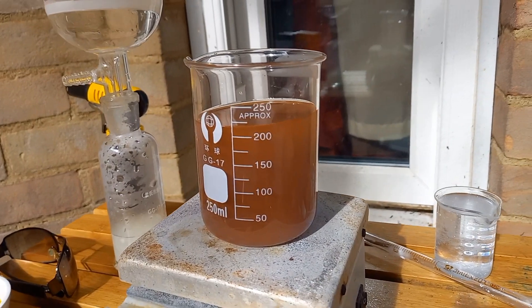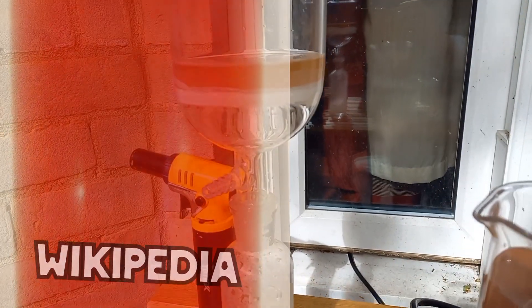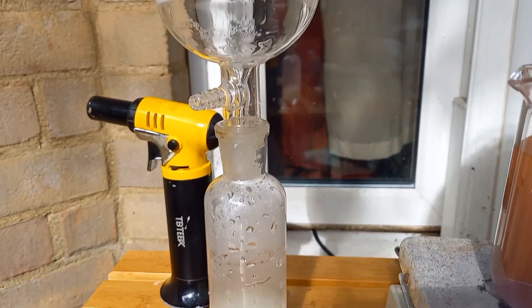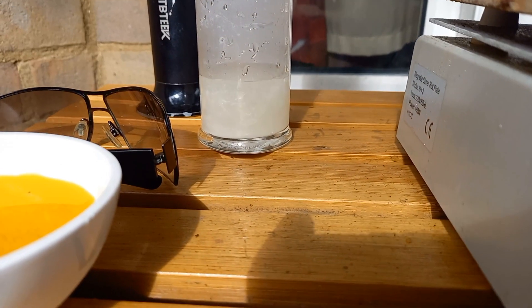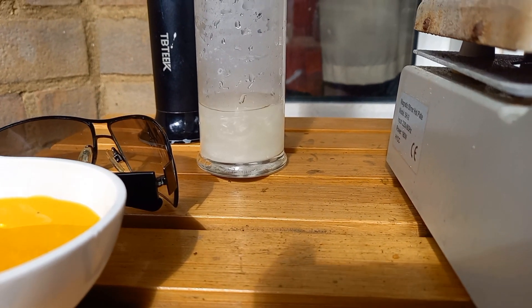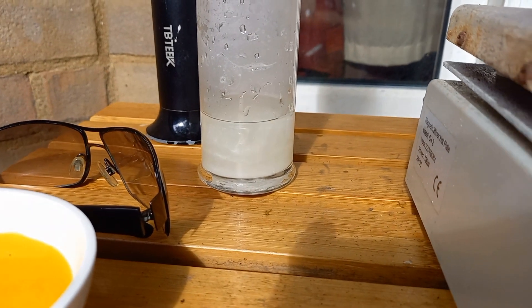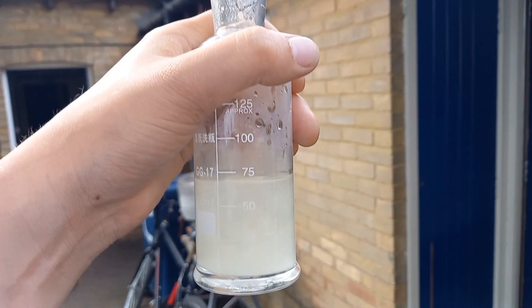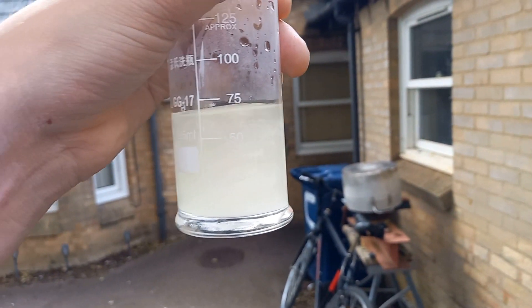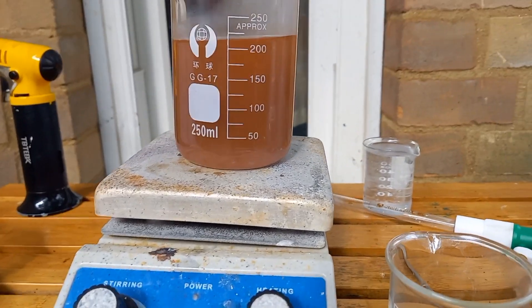So this is quite a nice color, it's not very clear. This is slightly more dilute. It's filtering through and I seem to be getting white solid in a clear solution. Quite strange — it's pearlescent almost. I think this shows the purity of my reagents isn't good. That's why this isn't as clear as it should be.